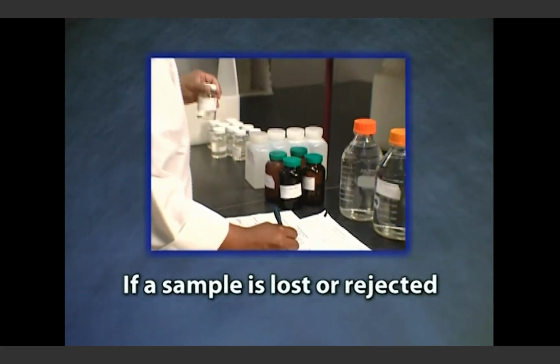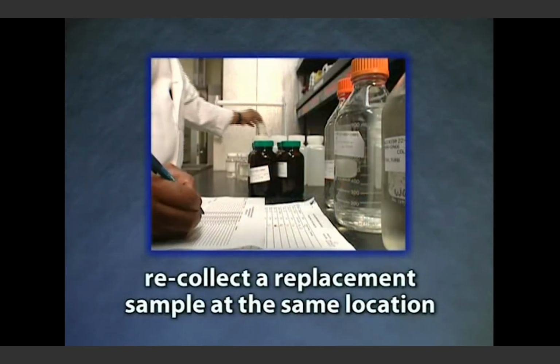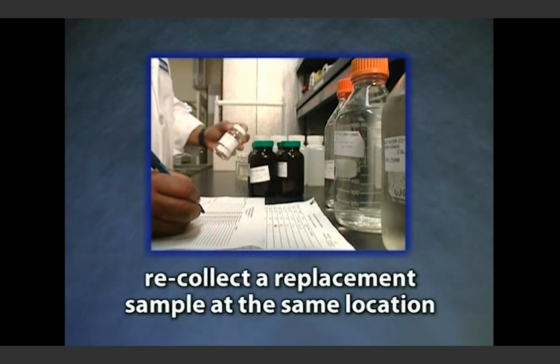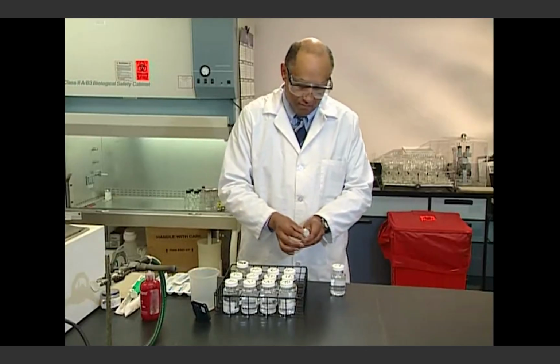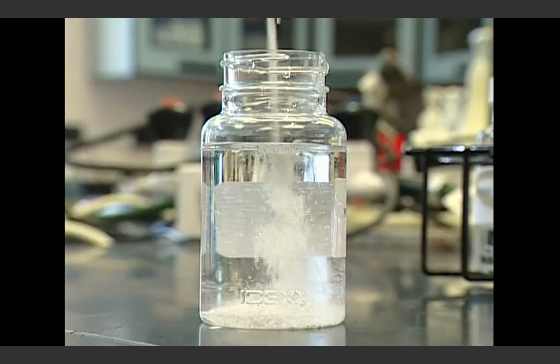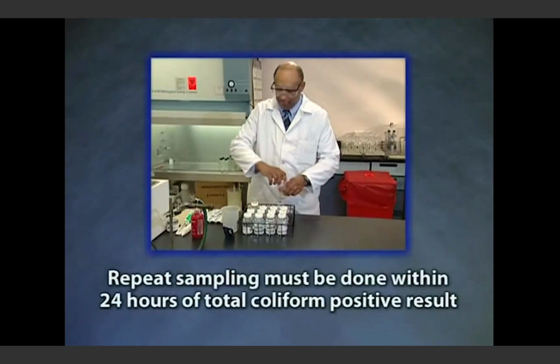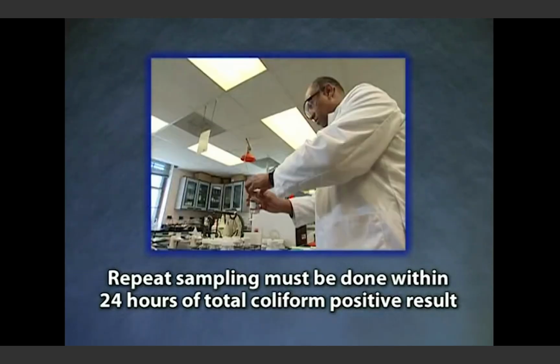If a sample is rejected by the lab or lost during transport to the lab, recollect a replacement sample at the same sample location as soon as possible. If any routine sample is identified as total coliform positive, repeat sampling is required, as well as a check for the presence of E. coli. Repeat sampling must be done within 24 hours of learning of a total coliform positive result.